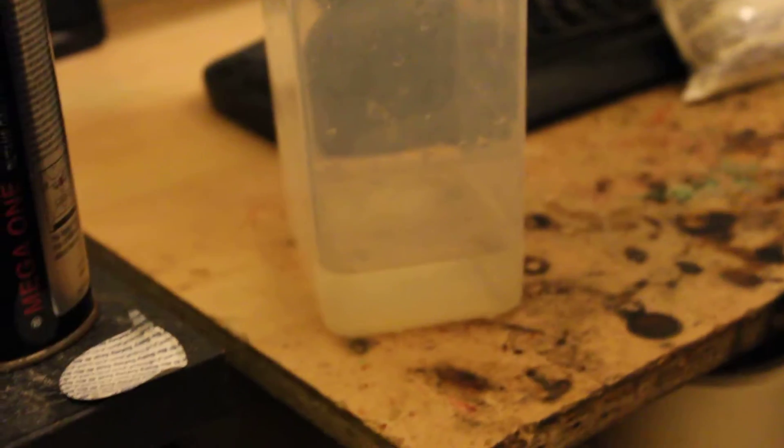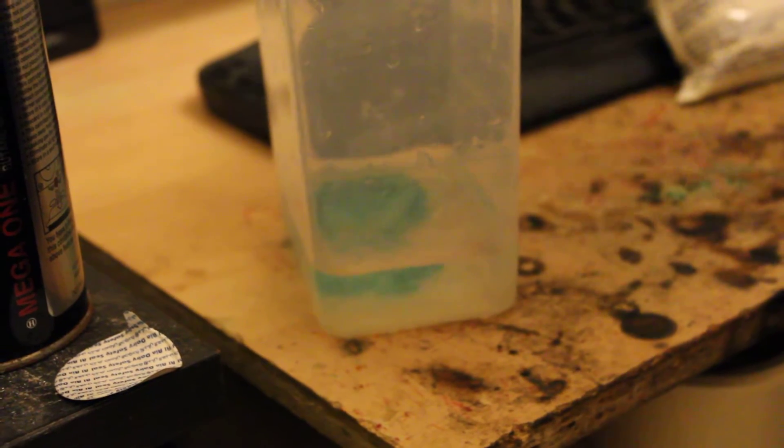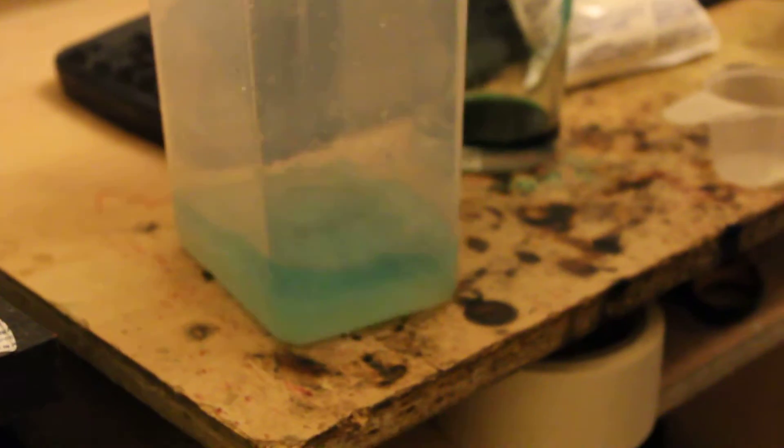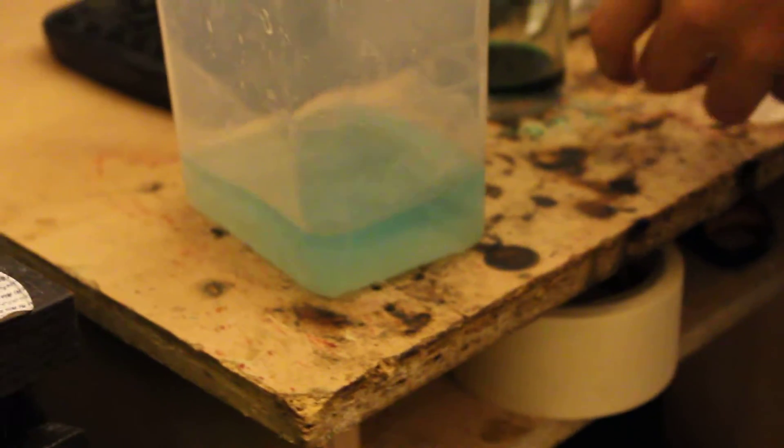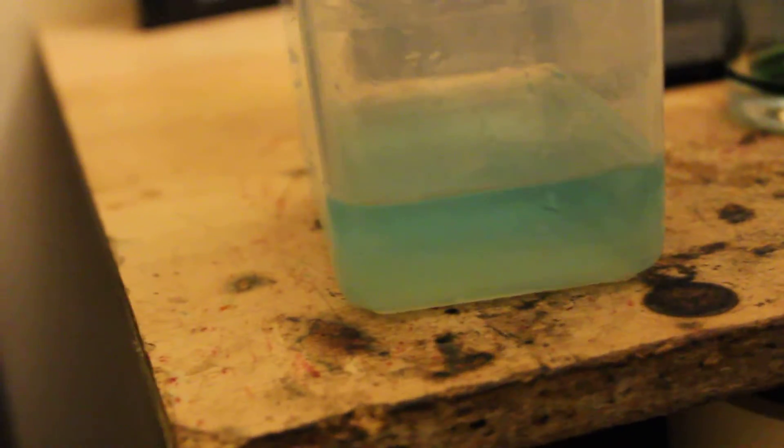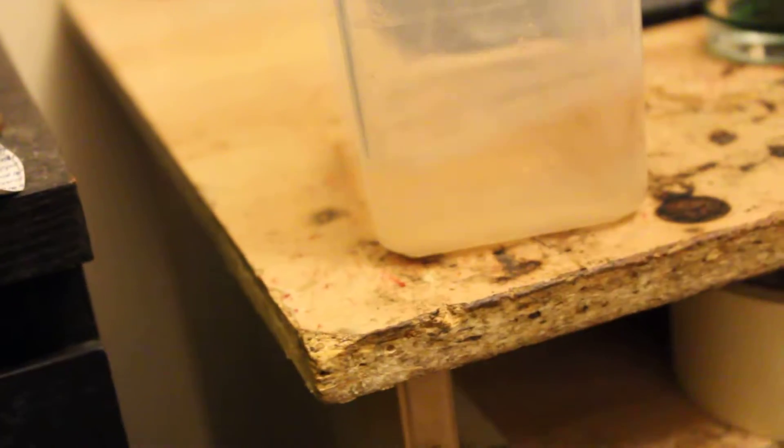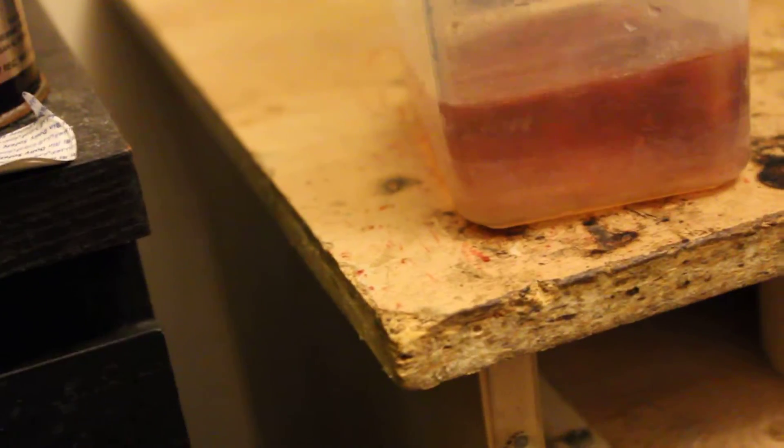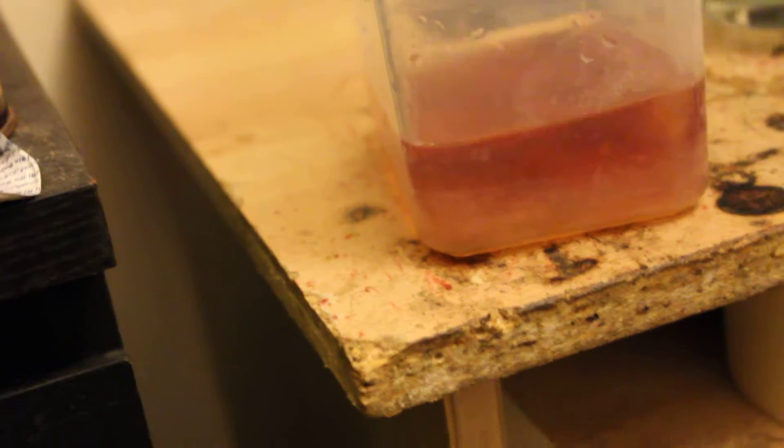So what we're gonna do is we're gonna drop this in here. You're gonna see that it's blue. But drop a granule—drop a granule of chlorine-containing compound. Just one granule this time. You're gonna see that that blueness will disappear. That is not blue anymore. See, just from that one granule, it slowly just turns red.